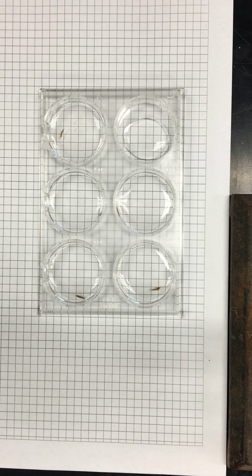What are we making those solutions in? That's a very good question, because we already have that. Oh, we make all the solutions in the Planarian water. No, but like, don't we have a test tube or something? No, probably not. I don't think that's a good idea. It can't hold like 12.